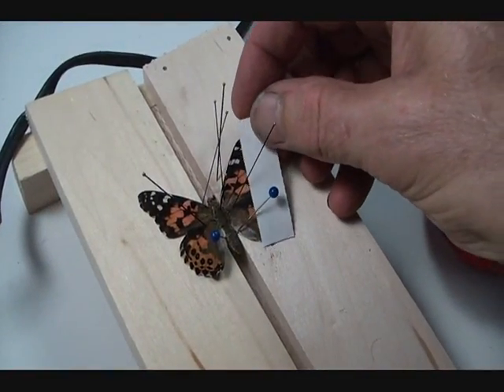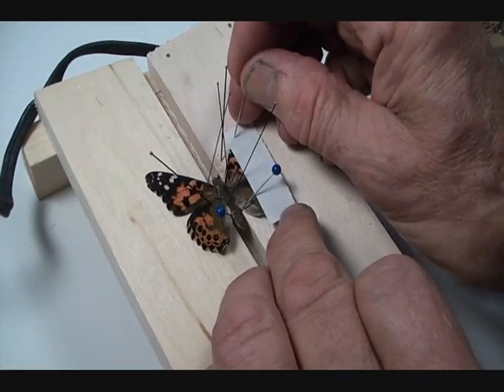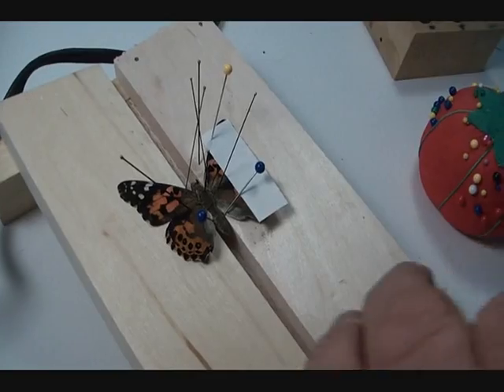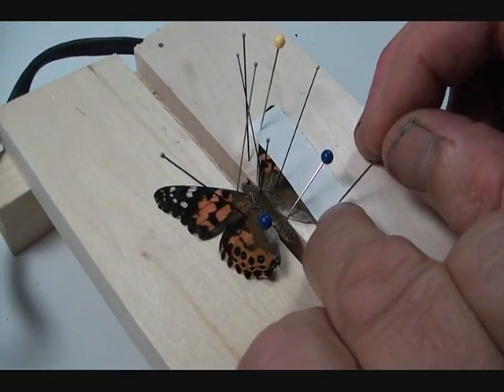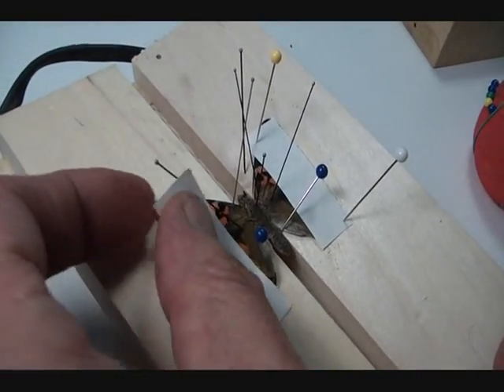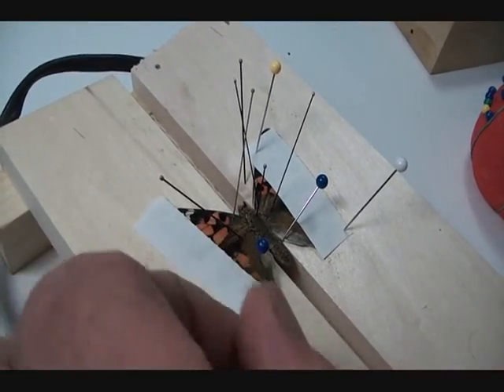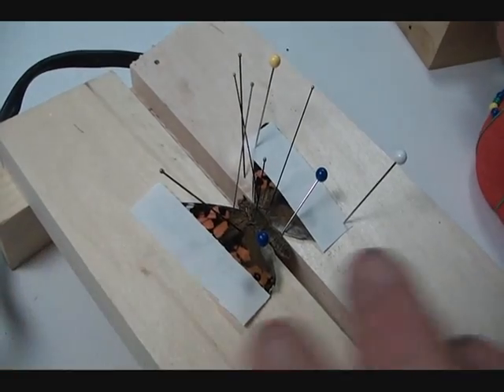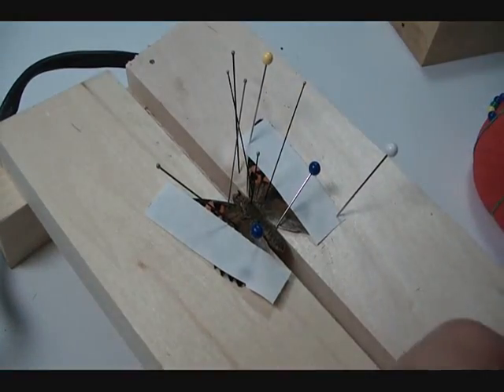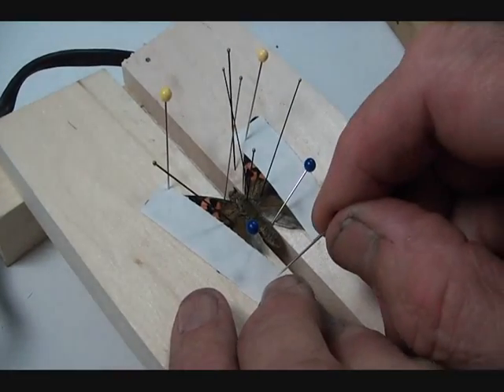The last step is putting some paper strips over the wings. It unfortunately obscures the wings, but you can remember where they are. Take a pin and pin it in firmly at the top, make sure it's flat, and then pin it at the posterior end — keeping the strip off the surface of the wings is better so you don't pierce the wings again. Do the same on the other side. Pin them firmly; you don't want them pulling out.